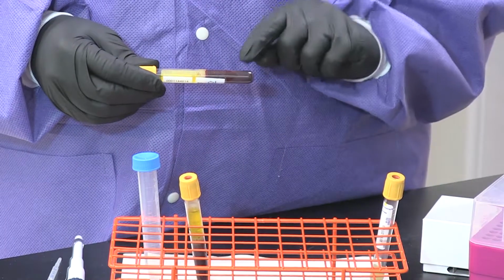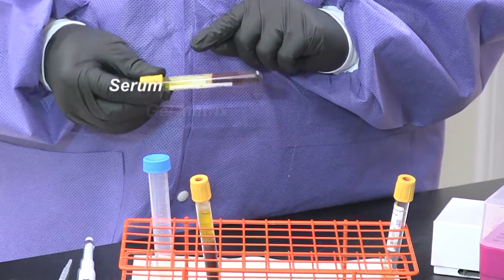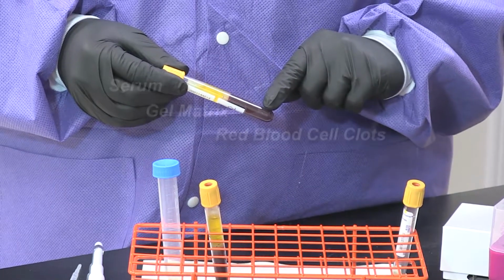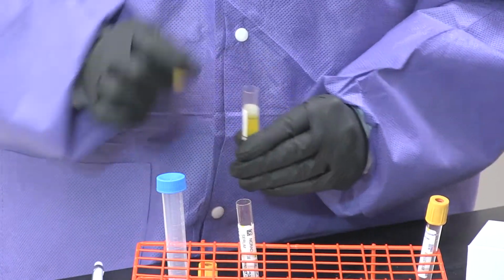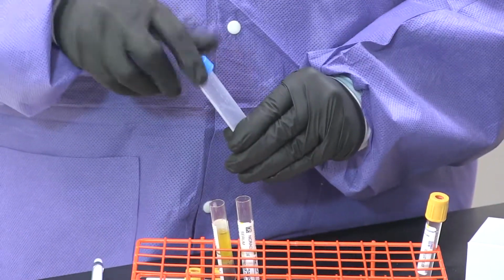After centrifugation, you're going to have 3 distinct parts. You're going to have your serum, your gel matrix, and your red blood cell clot at the end. You're going to transfer the serum from both 5 ml yellow top tubes into a clean 15 ml conical tube.